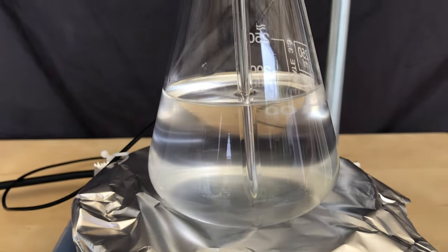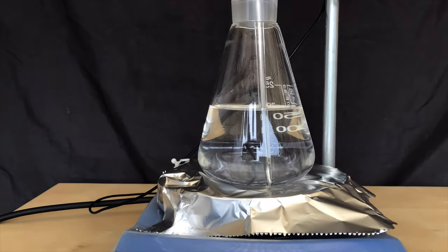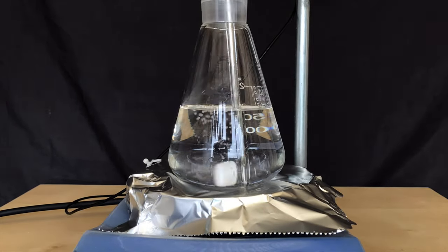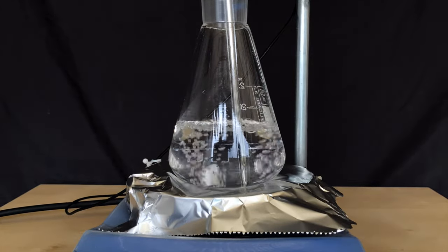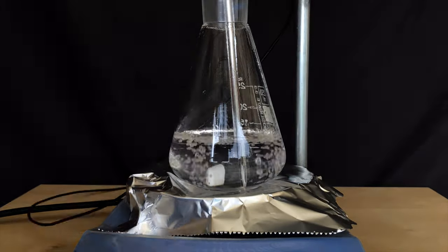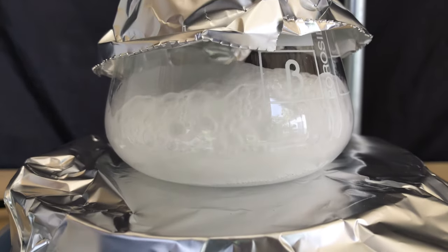I am going to evaporate off the ether and am not going to recover it because this ether has already been recycled once. Keep in mind, ether is highly flammable and this is a fire hazard. I am working in a very well ventilated area and there are no sources of ignition nearby.